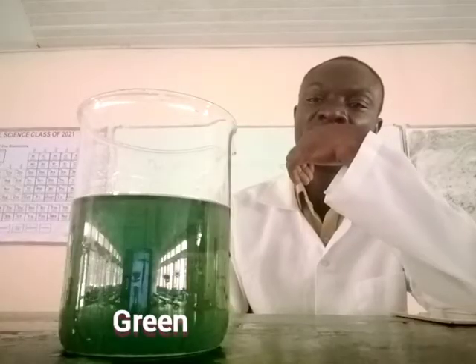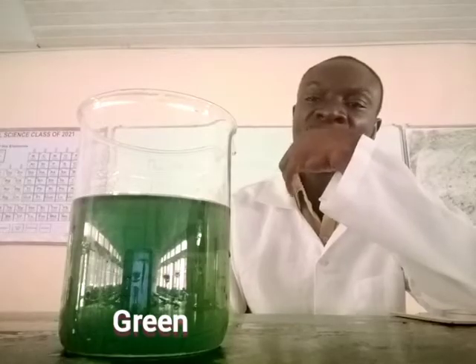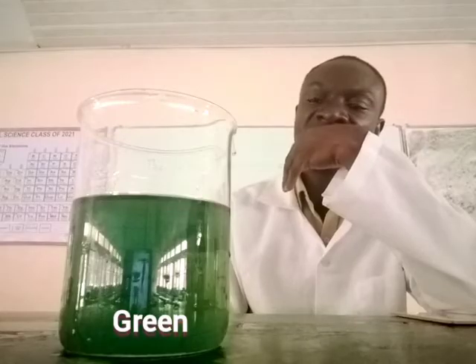It has turned from purple or pink to blue first, now is green.